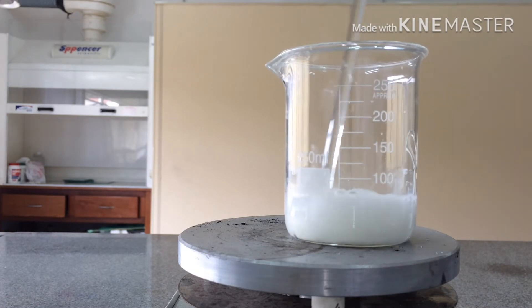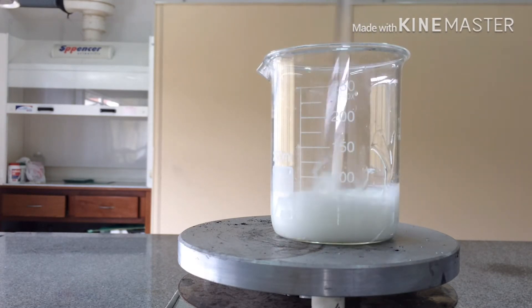And now you can stir it with a stirring glass until everything is mixed.